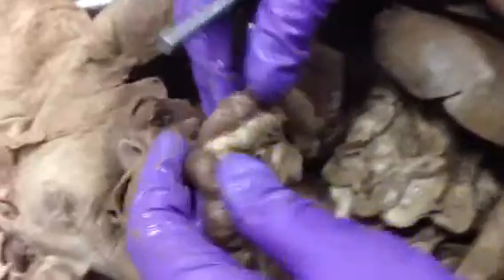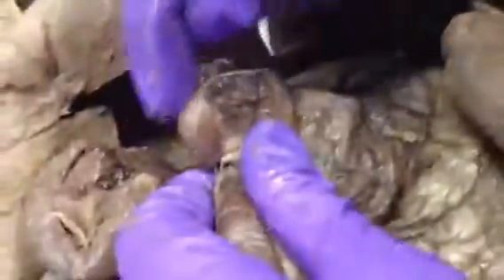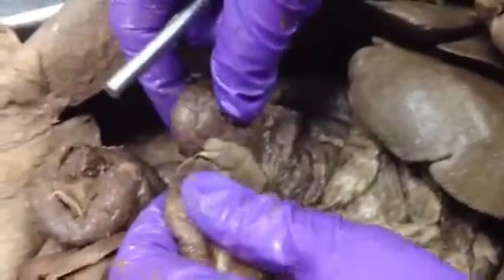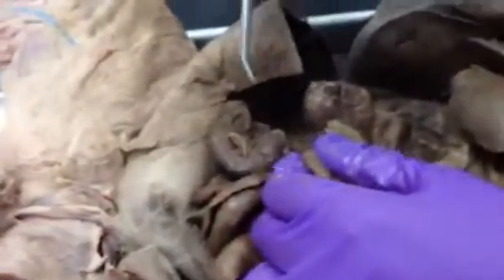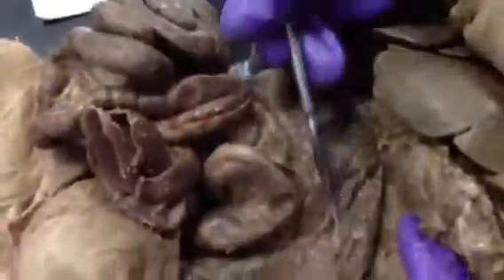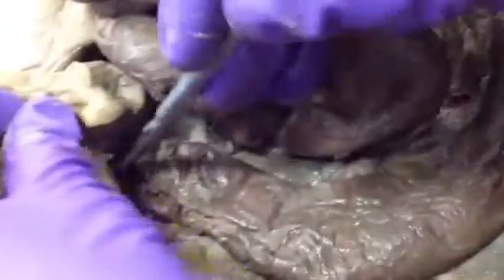And then so this end right here would be the ileum of the small intestine, and it goes to the cecum, which is right here, which is the blind end of the large intestine. So if the cat had an appendix, it would be off of here. The rabbit has it, and its appendix is off of here. This is the ascending colon. So the ascending colon, the transverse colon, and then the descending colon, which goes to the rectum, and then it comes out of the anus.